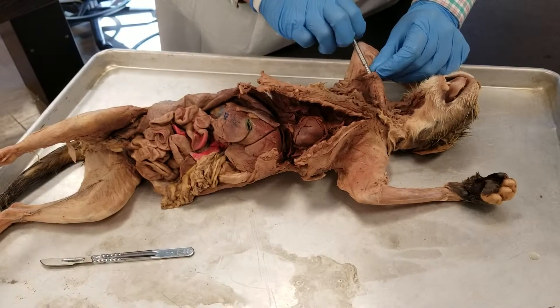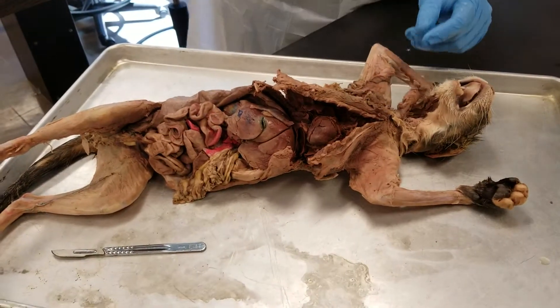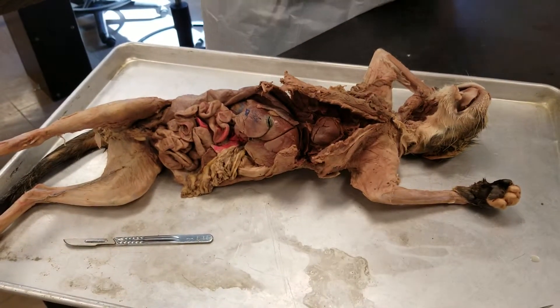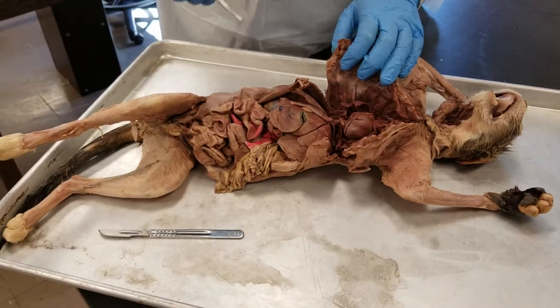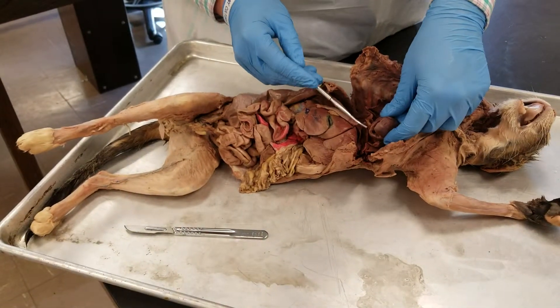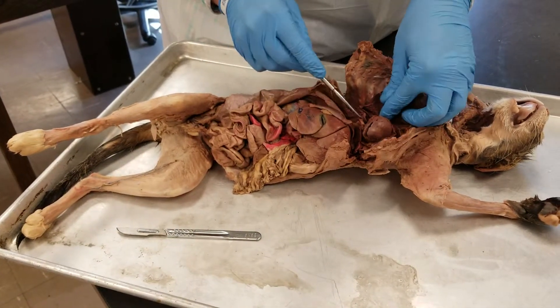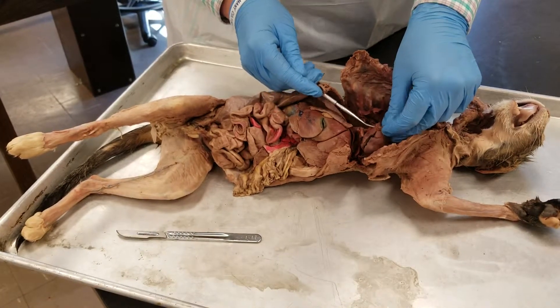This part goes down into here. Moving on, we're going to look at the heart. This itself is the heart. This material right here, and some of it around, is the pericardial tissue.